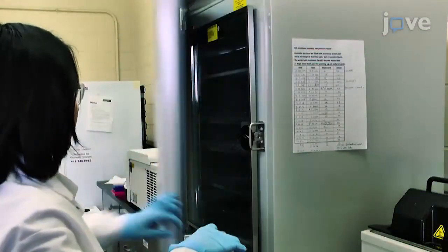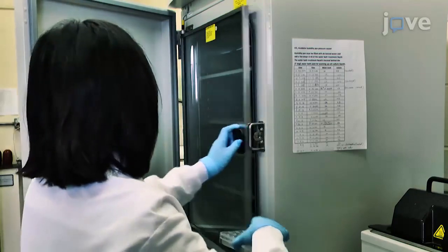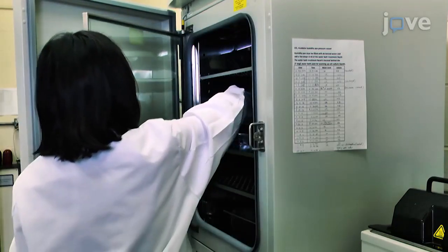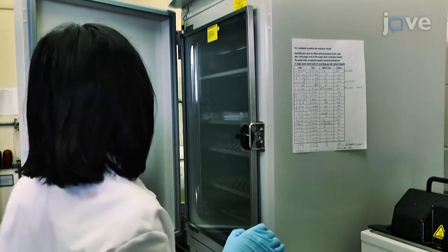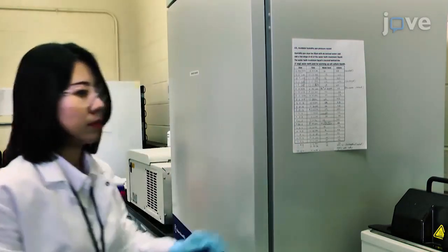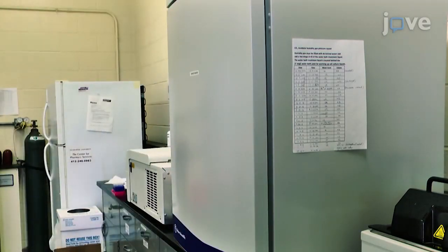Incubate for 1 hour in a 37°C, 5% carbon dioxide incubator. Rock the 24-well plate gently to allow even spreading of the collagen solution over the microporous membrane in the tissue culture inserts.